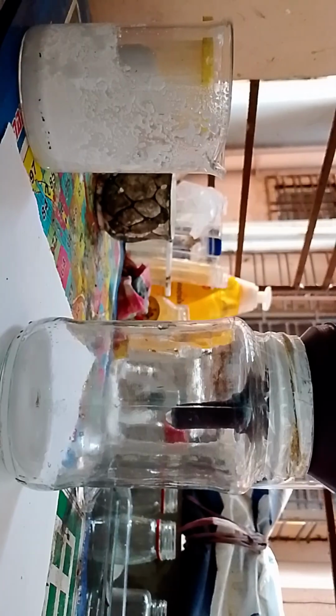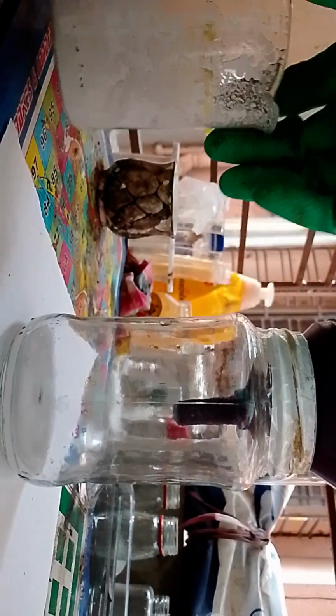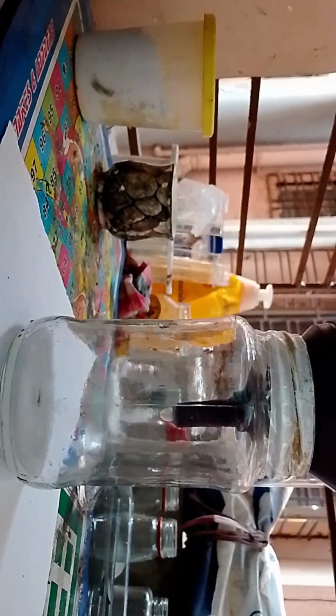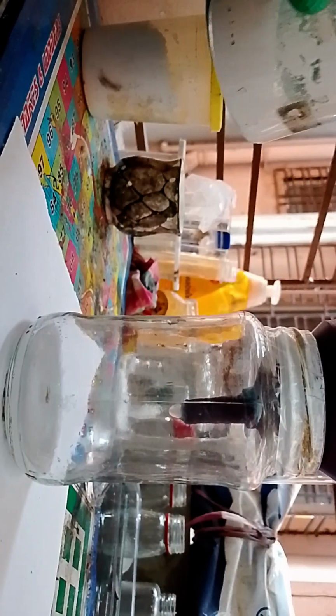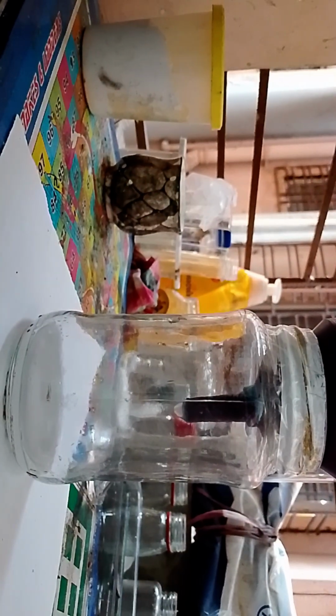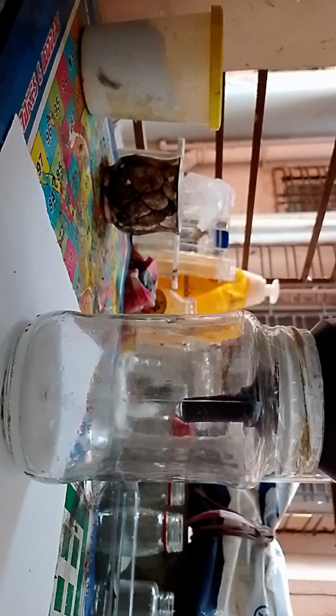Yes, it should react pretty well. Also, the solutions are heating up quite fast. I don't know why, but the solution is heating up. I'm going to pour slowly the excess sodium hydroxide and water.